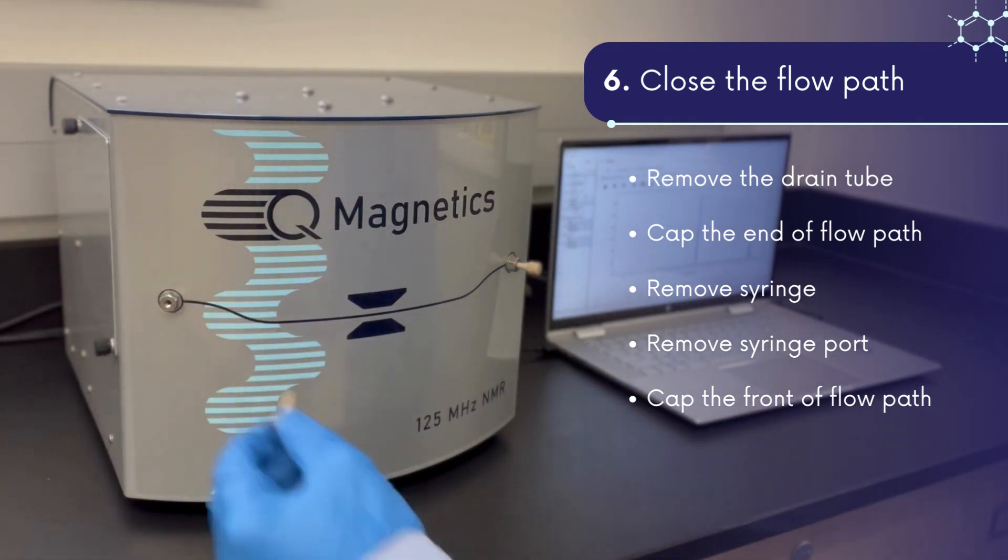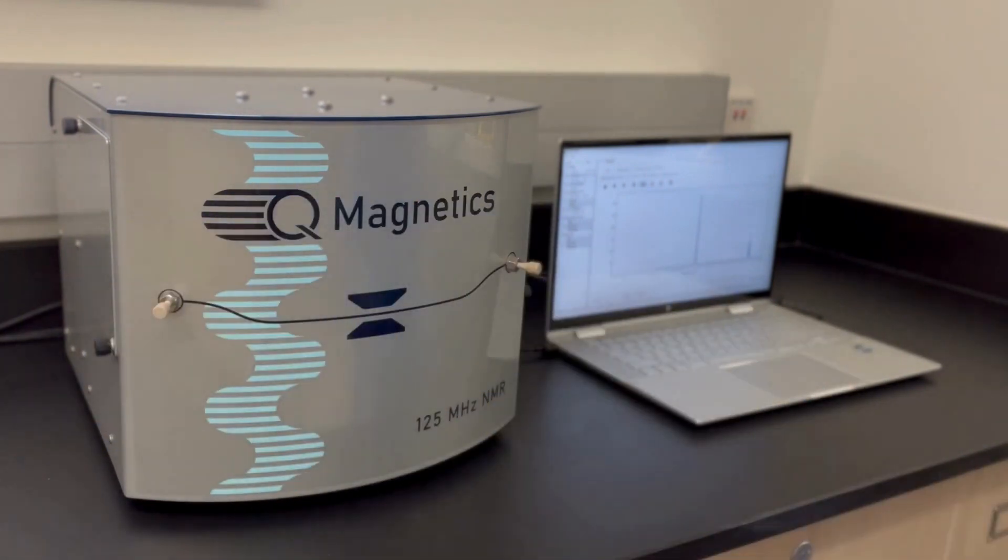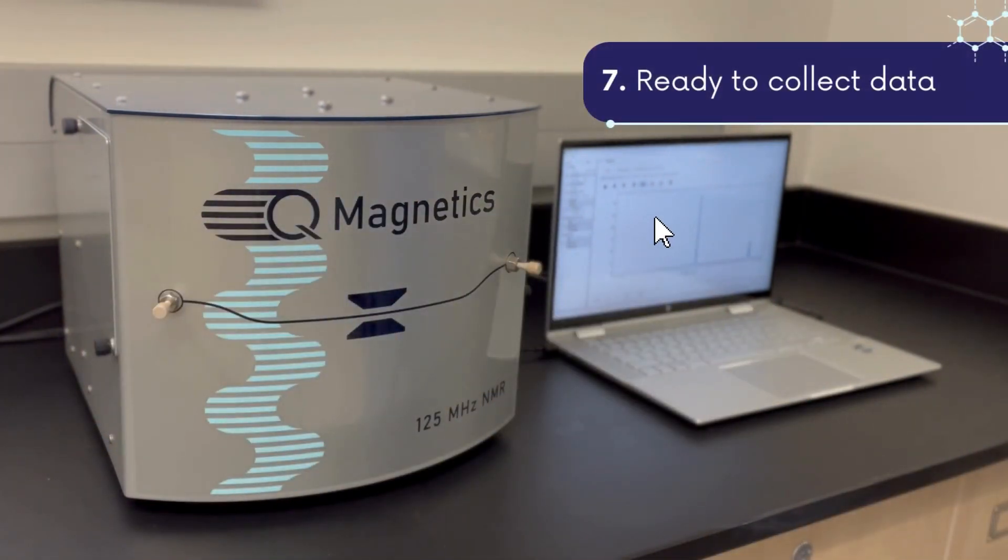We hope this video shows how easy and convenient it is to use the QM125. With the QM125, collecting NMR data is quicker and easier than ever before.